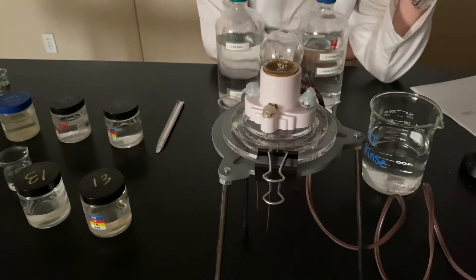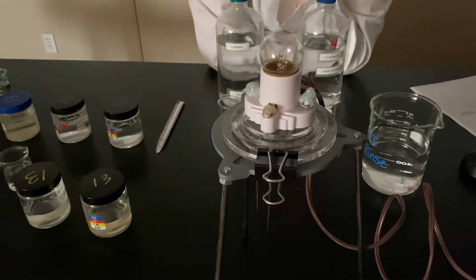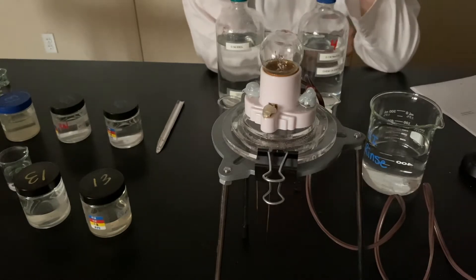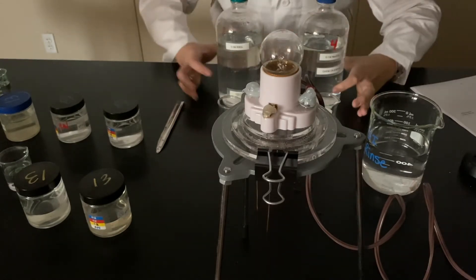Now we're going to test a double replacement reaction. So we're going to be mixing some potassium nitrate with some sodium carbonate.